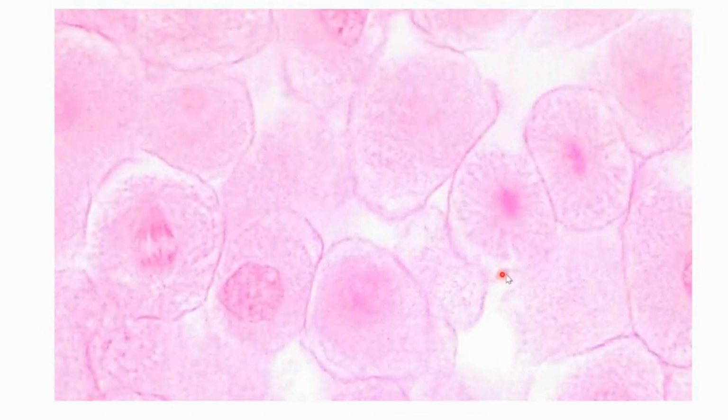Here's another cell. This image is a little bit washed out, but here's another one that we would say is in telophase. No, this one is pretty much completely divided from its neighbor. So we can see where it pinched off in the very middle. And we have two little nuclei with the genetic information that's right there. So this cell, if we were to talk about a late telophase, that would be this cell right here. We can see its genetic information in two separate places, and that genetic information is decondensed. It's fuzzy looking. And we can see that cleavage furrow very clearly. So there would be a telophase cell. Here's another prophase right here, because I can see the little polka dots, and another little anaphase over here.